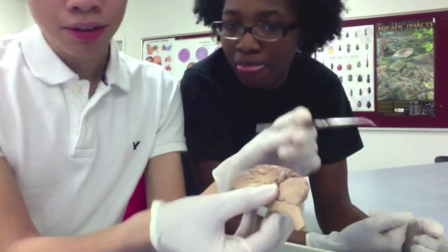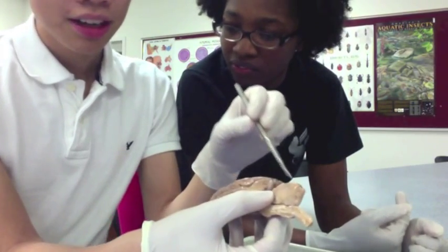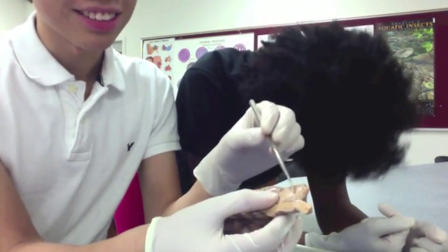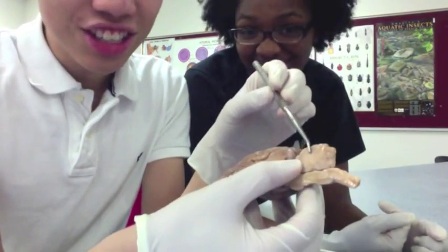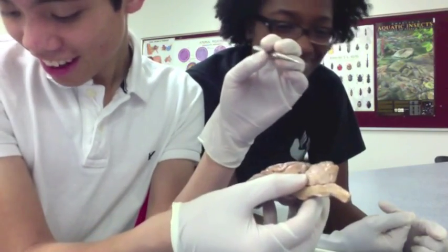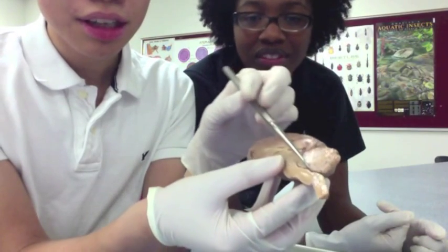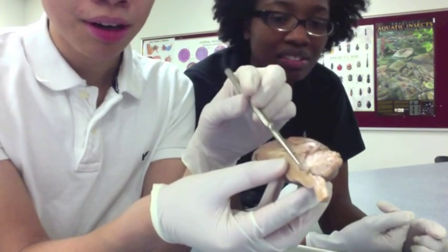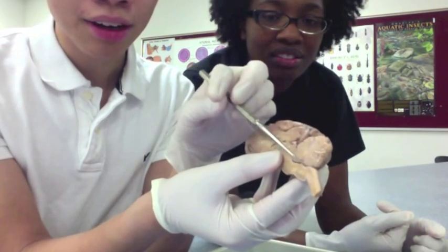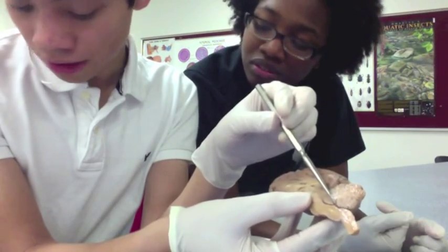You have your arbor vitae, which is the branches that you can see that come off. You have the fourth ventricle, which is this section right here, where all the branches connect — that's your fourth ventricle.